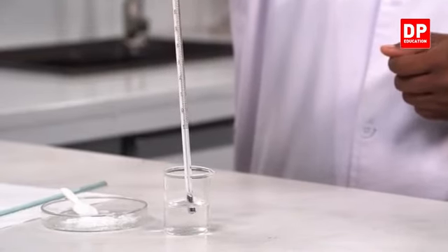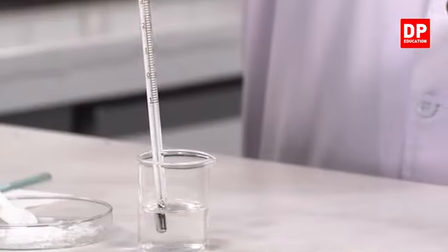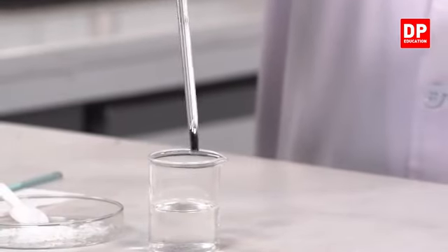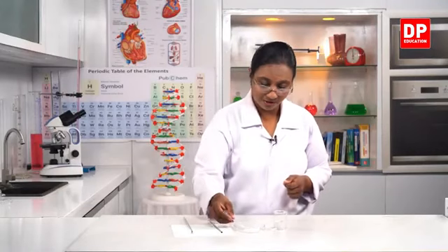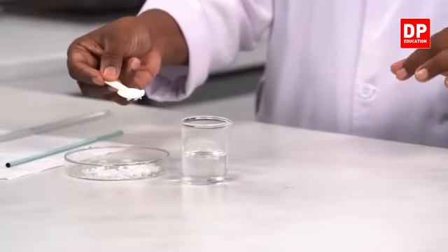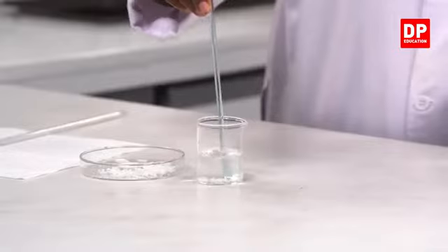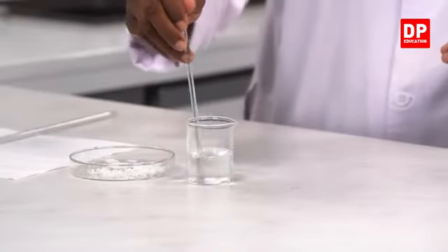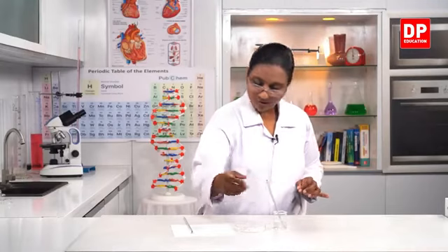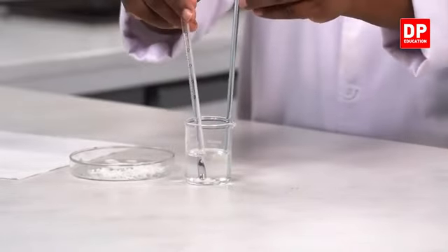Can you all see the temperature, students? Can you all see the temperature reading? It's 25 degrees Celsius. So that is the initial temperature of the sulfuric acid solution. Then what I will do is, I will add a few pellets of sodium hydroxide. Now you can see these are the sodium hydroxide pellets. When we put them into the sulfuric acid solution, you all can observe what happens, and also I have to stir it and mix it well so that the sodium hydroxide dissolves. So after dissolving a little bit, I will hold the thermometer in, and with that I will dissolve it further.